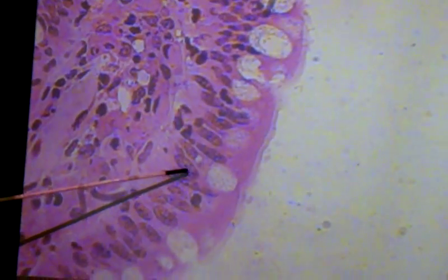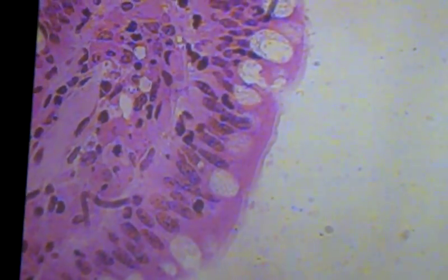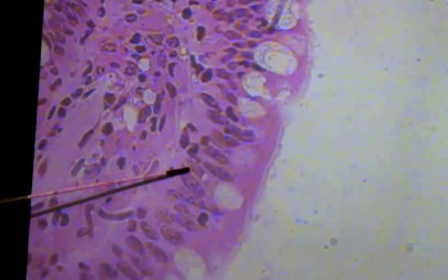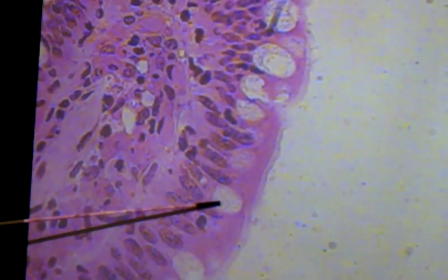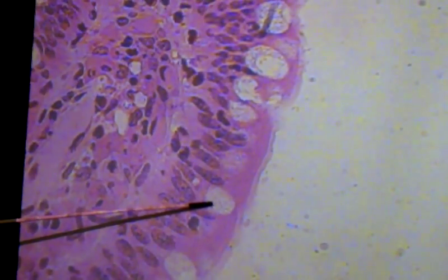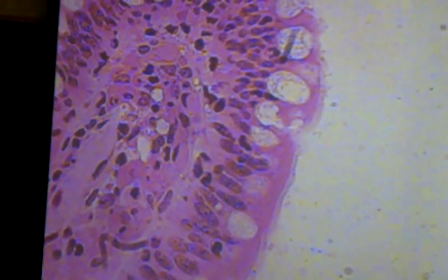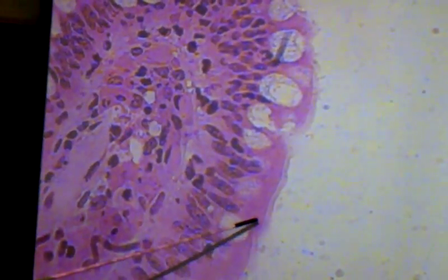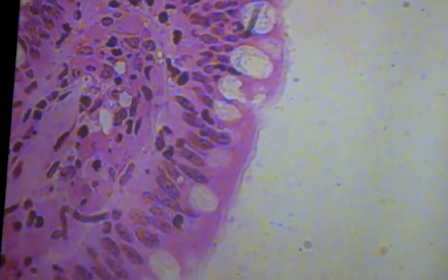Goblet cells look very similar to the rest of the epithelial cells. On the practical, the way he would have you identify goblet cells is instead of pointing at the cell itself, he points at the mucus droplet and says 'name this cell' — just say goblet cell. The reason they're called goblet cells is they kind of look like a cup, a goblet.